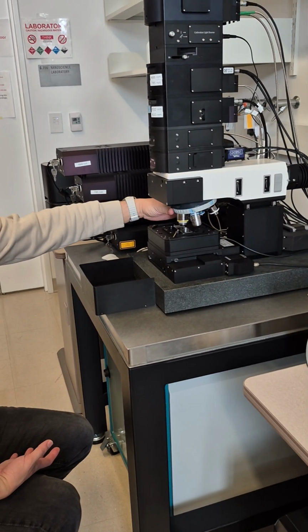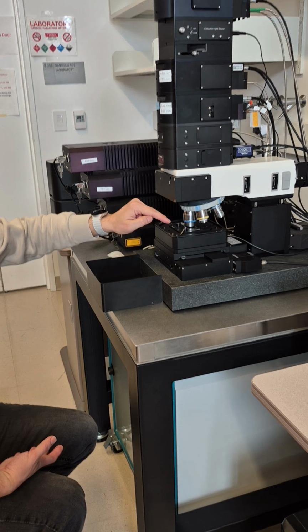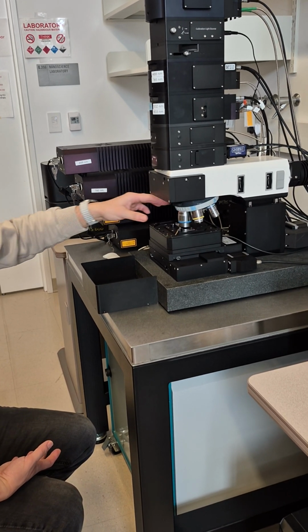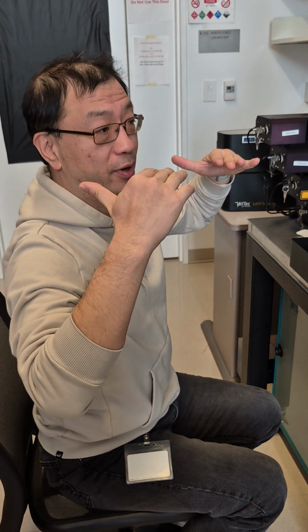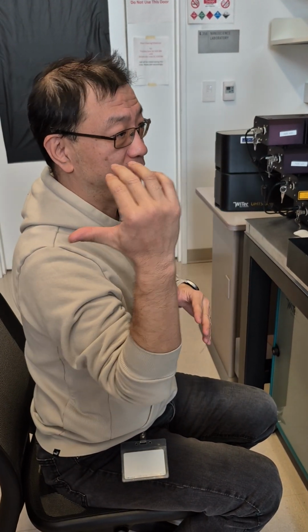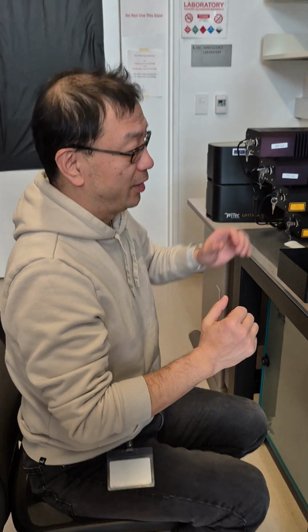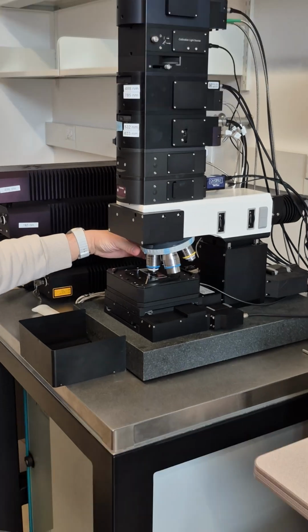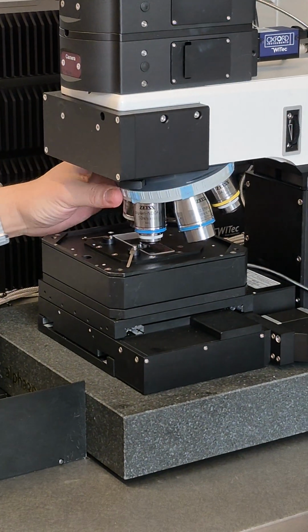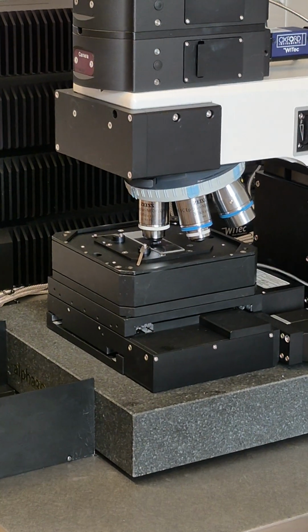So I'll show you how to use number 2. Is it very scary, right? It might scratch. All the lenses' focus are calibrated. They're not perfect, but once you focus on the sample surface with lens 1, you won't worry about the rest of the lenses hitting the sample. And number 3 is also very scary, it's very close. And then number 4 is the shortest. It looks like it's already touched, but it's okay.